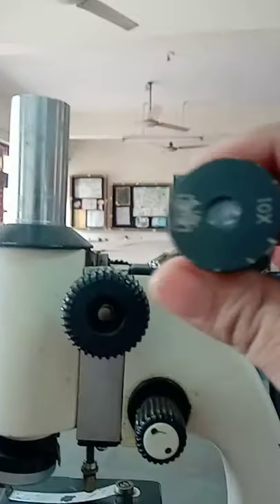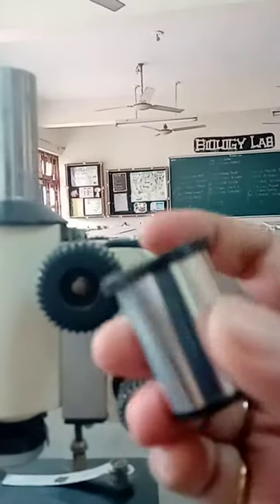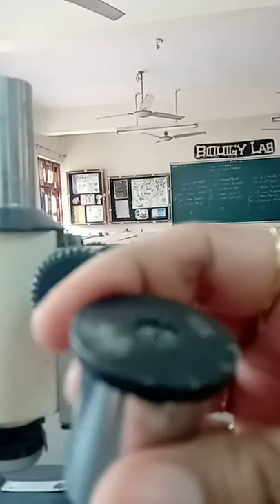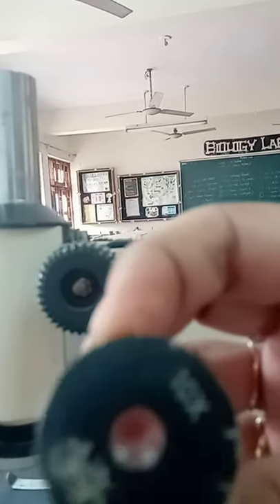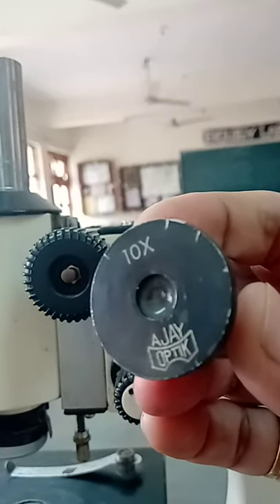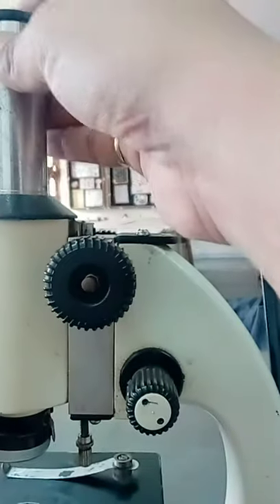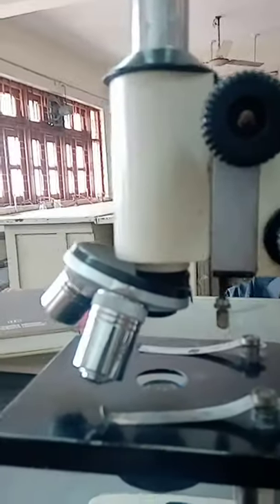A compound microscope has an eyepiece which can be of different magnifications: 5x, 6x, 10x, 12x, and 15x. Right now, I have an eyepiece of magnification 10x.